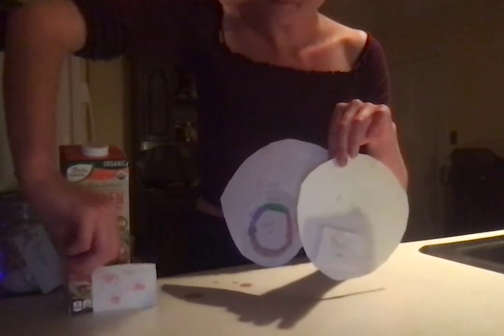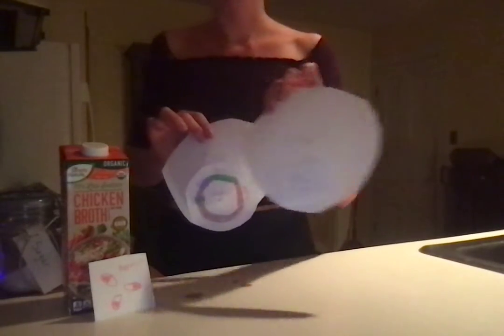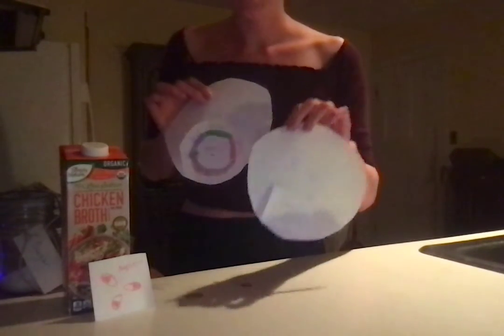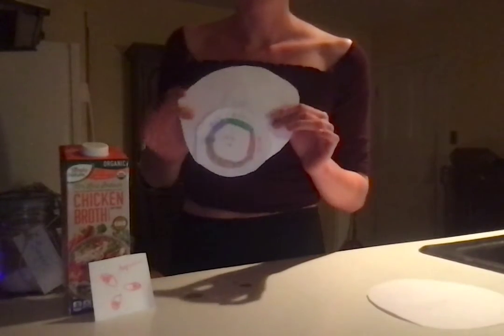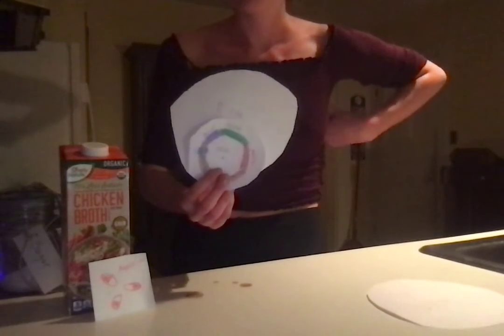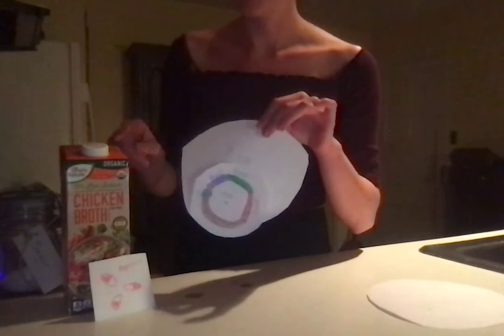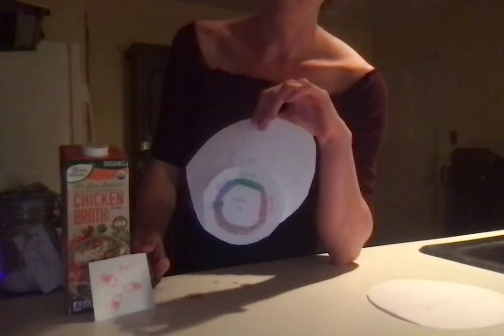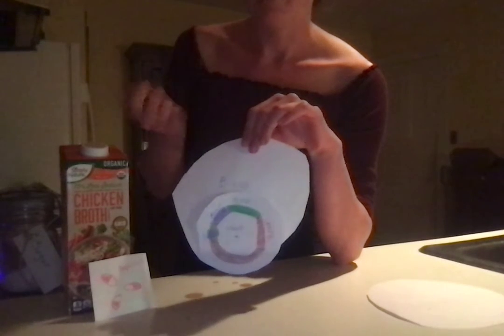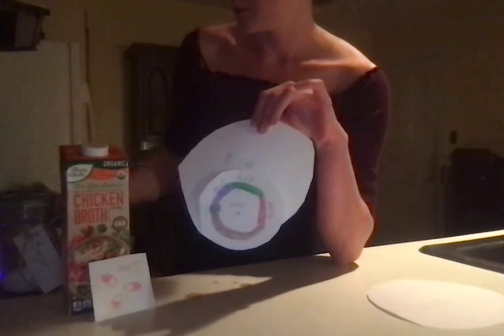Now, only once we add the ampicillin, our pGlow negative will no longer grow because they don't have the ampicillin resistant gene. So bye-bye, you're dead. Only our pGlow positive will be able to grow and replicate. So in the presence of our Luria broth and our ampicillin, only the new transformed bacteria is able to grow. But we can't make that happen until we activate that regulator site by adding arabinose.